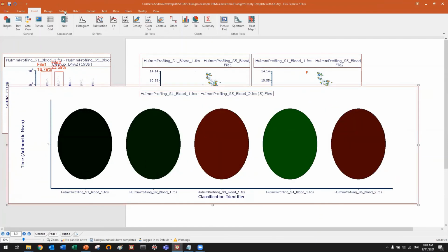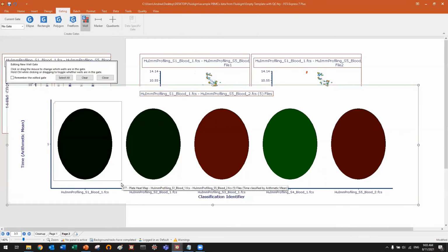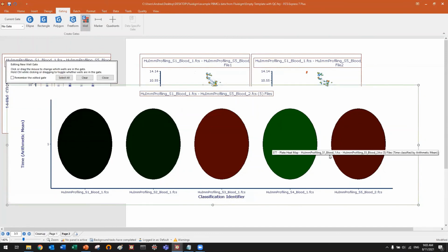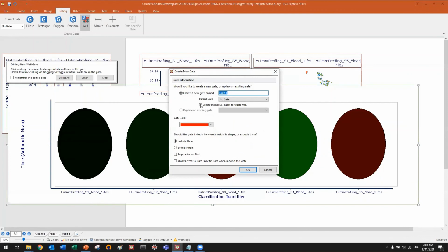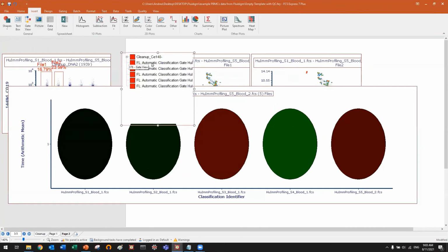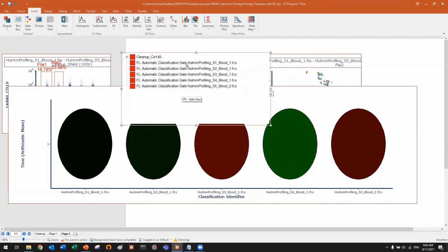Then I can create a gate on a single well, this will be file number 1, or let me create gates on all. And I can say create individual gates for each well. So this will be my file gate. Okay. And now I have automatically created them. This is great if you have like 10, 20, 50, 100 files. You see a gate for file number 1, a gate for file number 2, file number 3, file number 4, file number 5. So they are already created. And then you can retrieve statistics for all of them. So there are really infinite ways in which you can proceed with your analysis from this point.